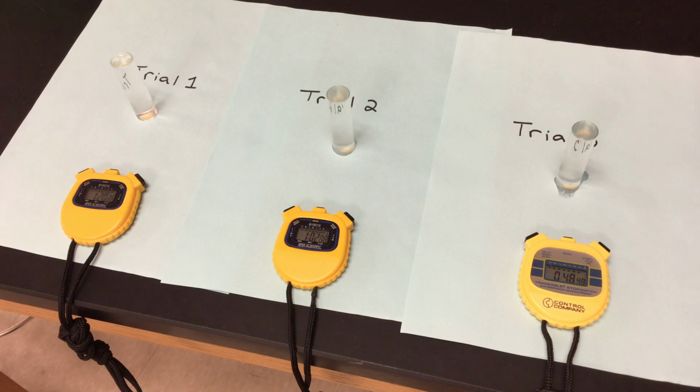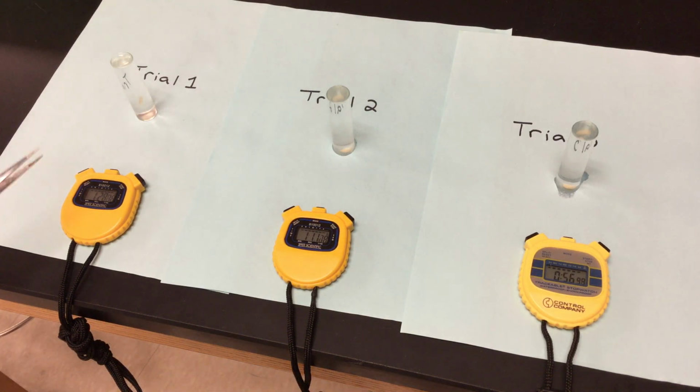So we know for pH of 3, we were at 4 minutes all the way across. And here comes our first disc. If you guys are watching that, our first disc is kind of making its way up. It's floating in the middle. We're gonna let it go a little bit longer. It's kind of just suspended in air there.